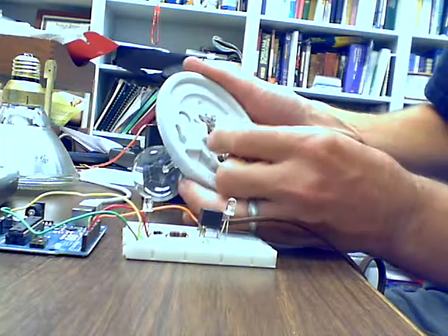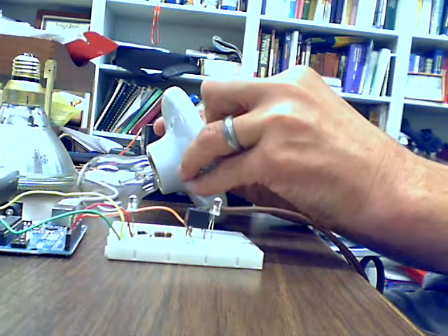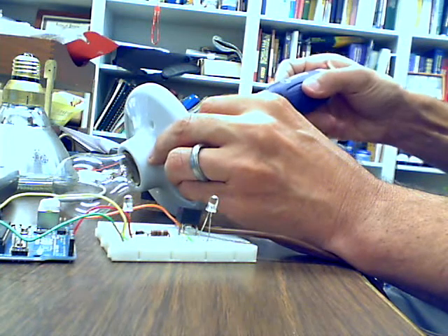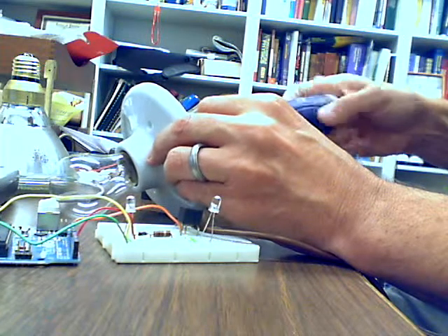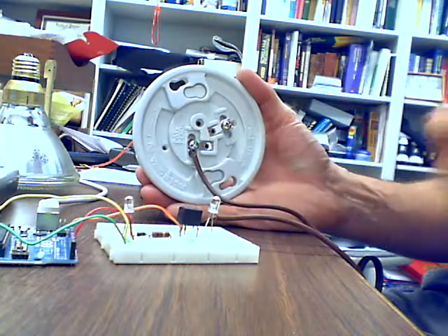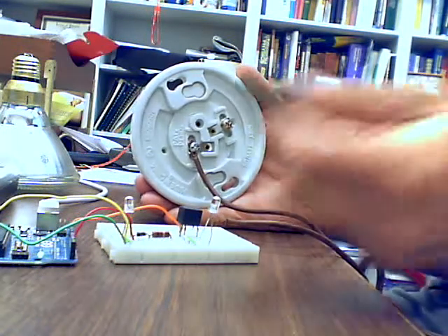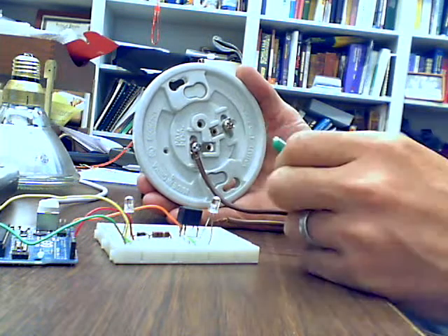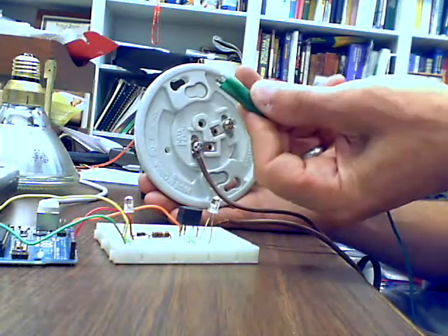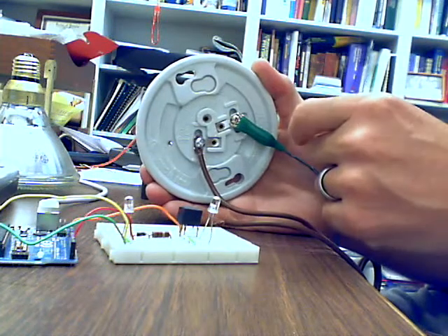Okay, so I'm just going to take this exposed wire and wrap it onto one of these screws, and use my screwdriver for tightening it. So I now have one wire connected here. The other connection, I'm not going to make permanent connections here, so I'm going to use alligator clip wires. What you would want to do is use actual wire that you can connect here and then solder to the circuitry here. So anywhere I have an alligator clip, consider that to be temporary, whereas you'll want to make something more permanent.